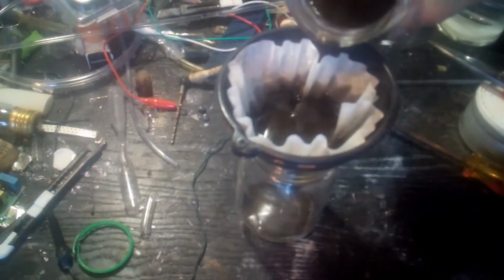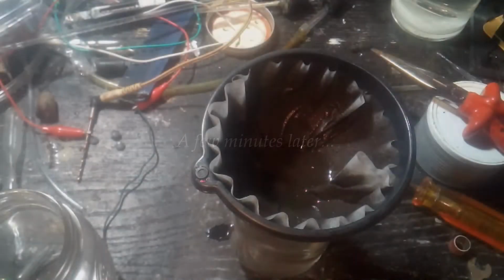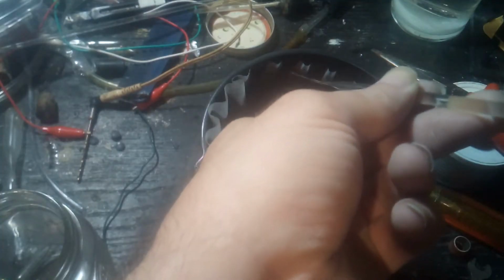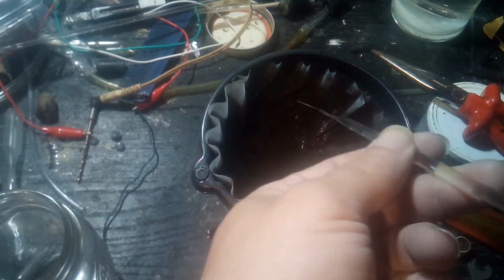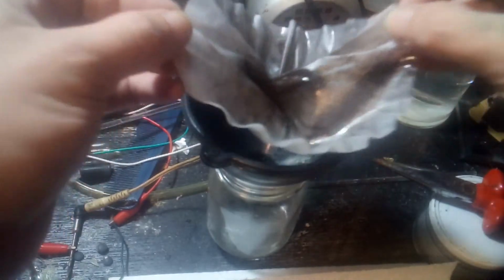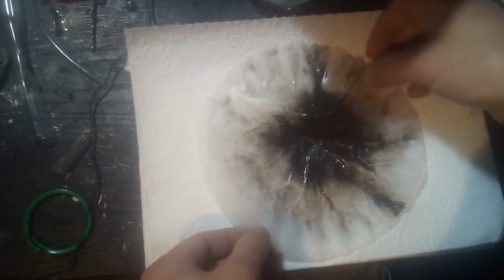No, be a good coffee filter. The boron is almost done filtering through. So I have a syringe full of distilled water with a little glass nozzle that I made. And I'm going to use that to essentially pressure wash the boron that's stuck to the edges of the filter here and get it all collected down at the bottom. The rinse water is done filtering through the boron. So I'm going to take it out of the funnel. And lay it down on a paper towel so it can dry.